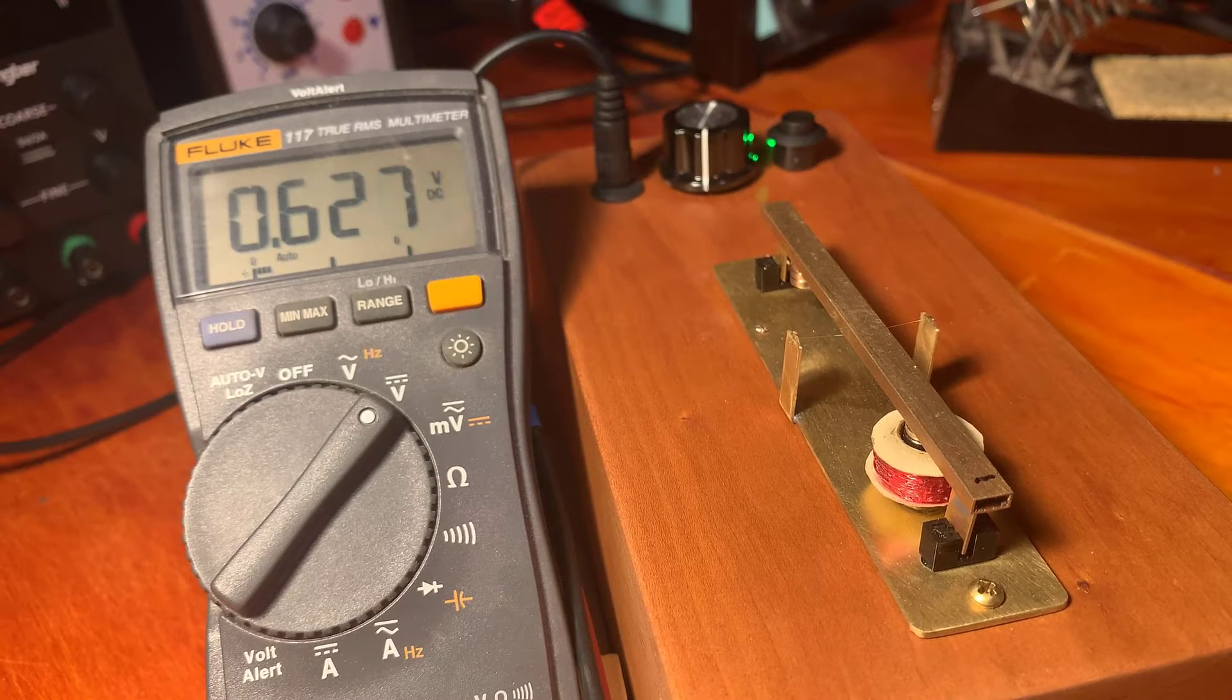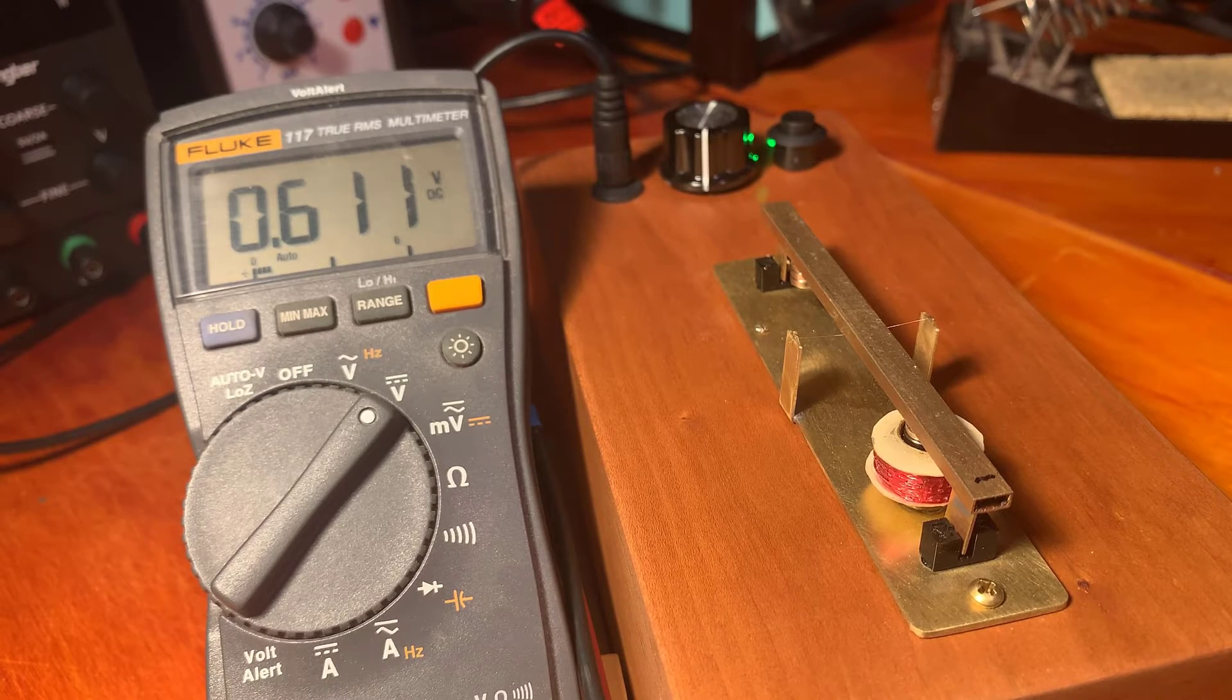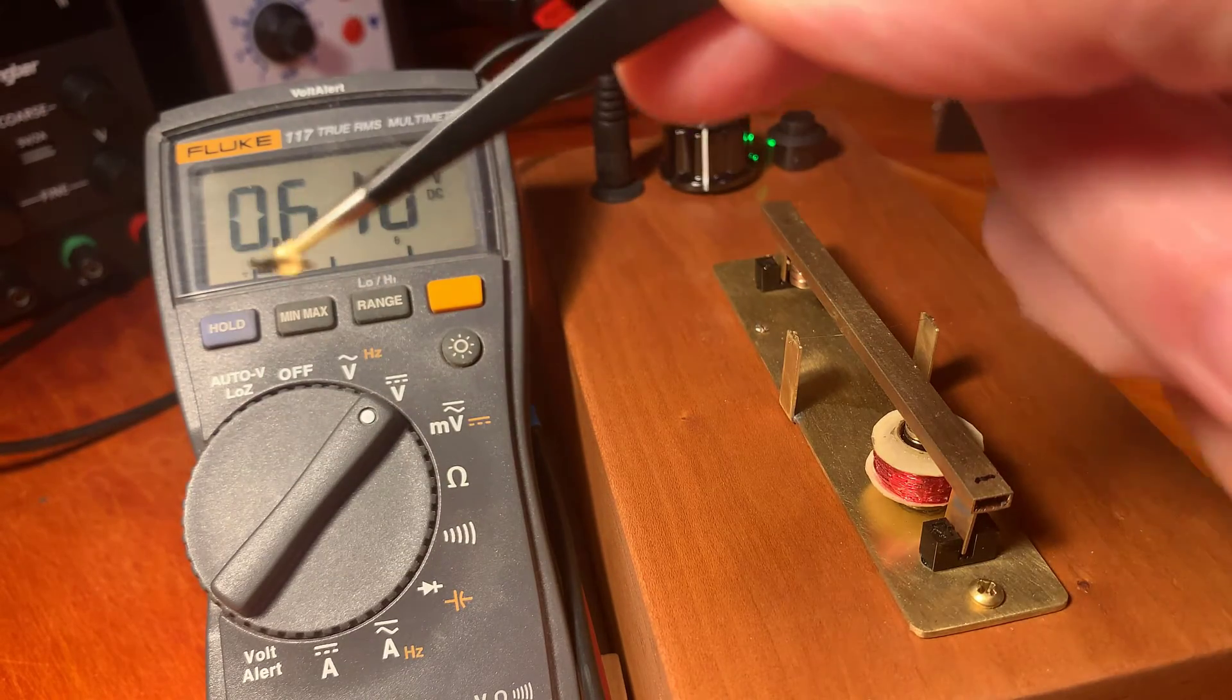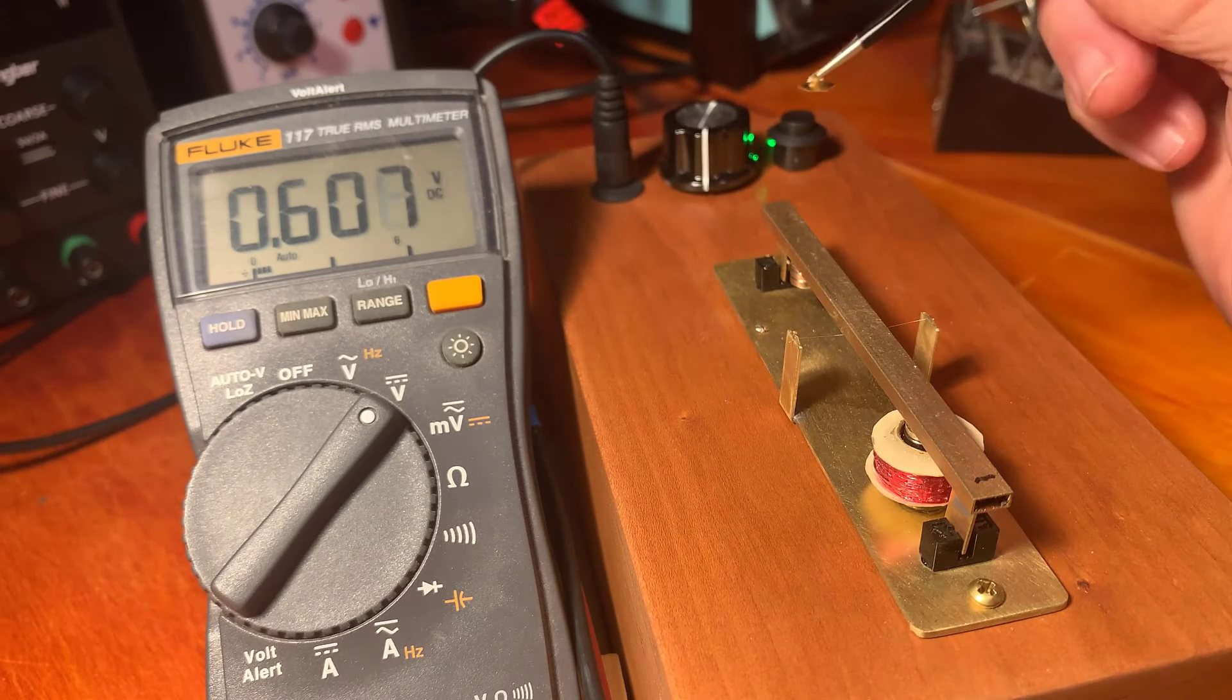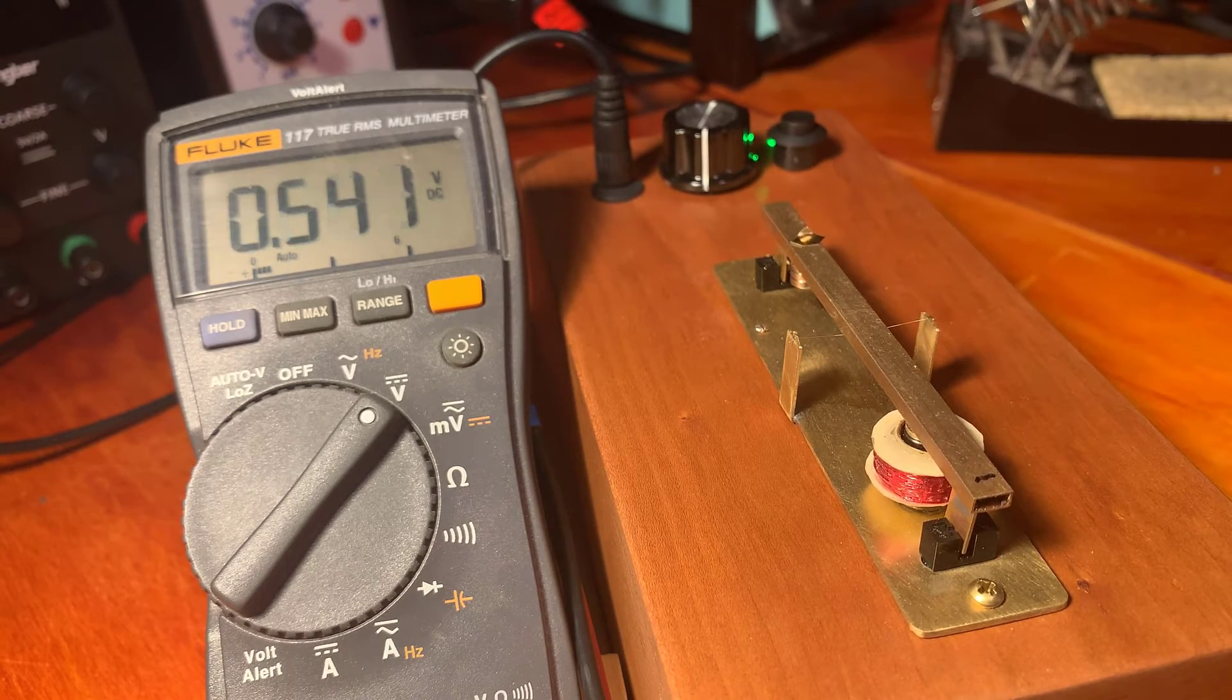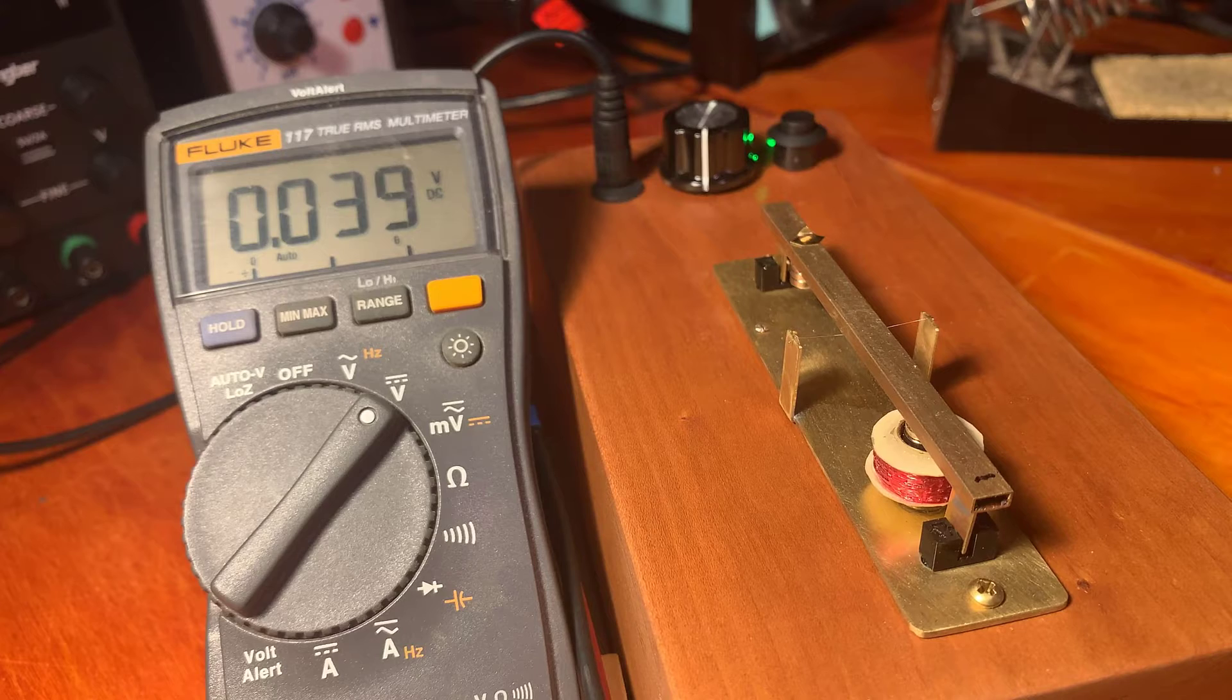So to get this close to balance, that just means the beam's slightly out of balance. I have this small piece of brass. It's 0.1 millimeters thick. And if I put that on there, I want to first get a rough mechanical balance. This is the way that I do it.